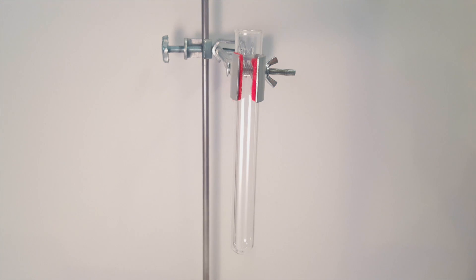So, now let's get into the demonstration. First, I had the water with the diluted cyanidin, which starts out as this nice pink color. In this attempt, I also added a bit of 5% acetic acid to the indicator solution to make the change in color more pronounced. This actually ended up being a mistake, which we will see later on.